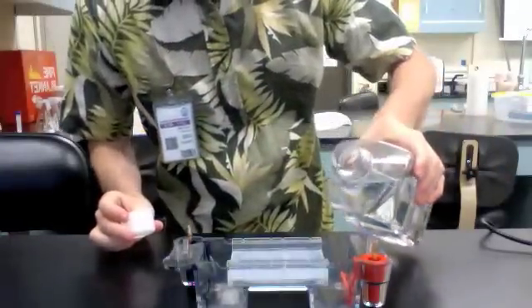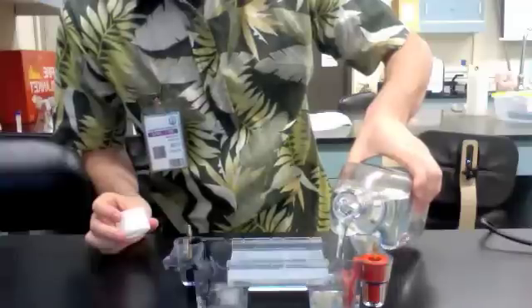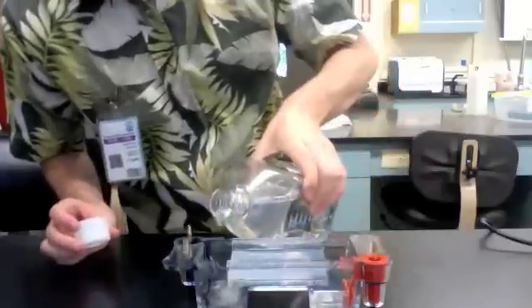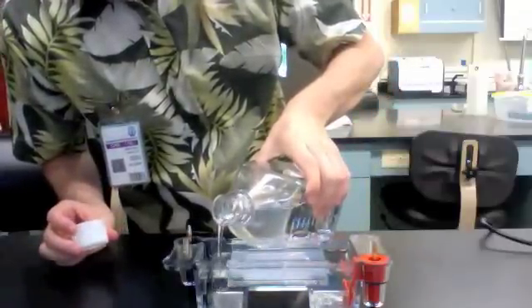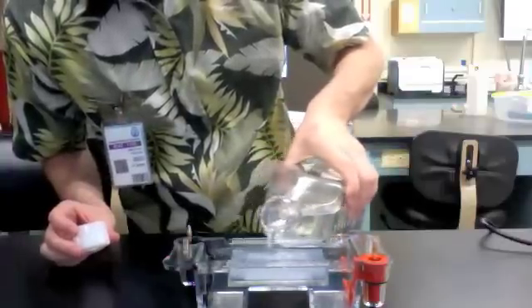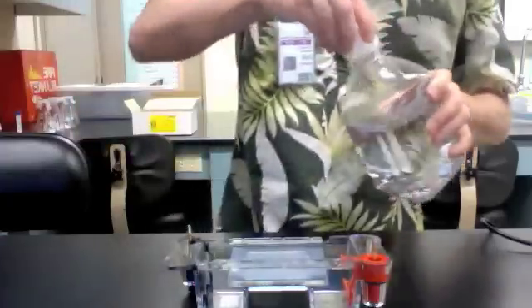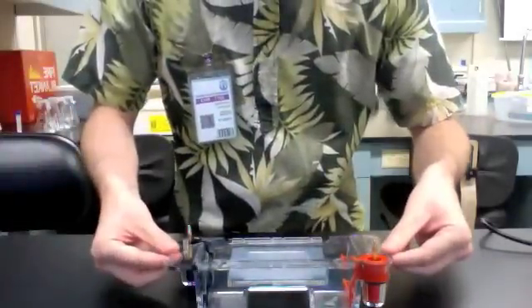Fill it until it just covers the top of the gel. I'm going to pour some in this side, and it'll start flowing over to the other side. I'm going to pour into the other side till it equals out and make sure that it just covers the top of the gel. Now you have your chamber set up and ready to go.